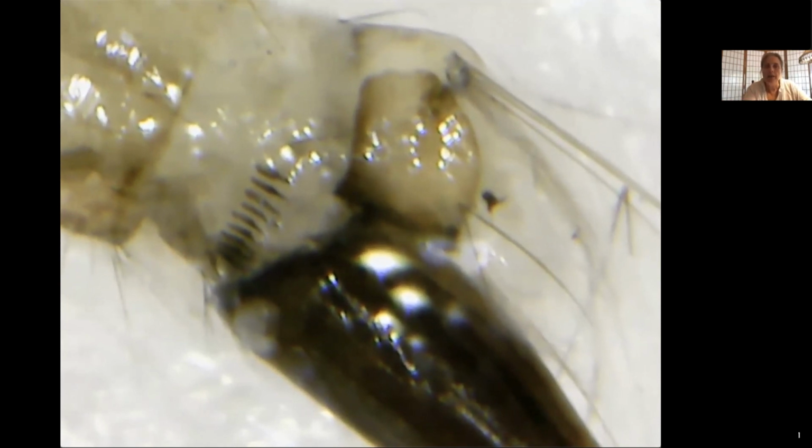But anyway, if this went completely around the terminal segment there, you wouldn't see a little bit of that white tissue there. Instead, it would be that darker stuff going all the way across. And if you flipped it over, it wouldn't go all the way around. So what we have here is a saddle that partially encircles. It is not pierced by hairs.